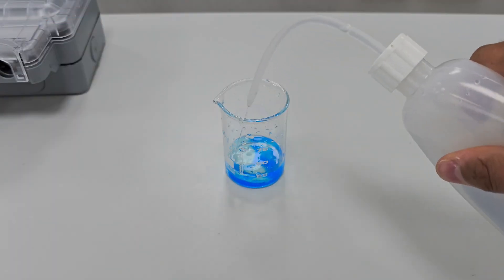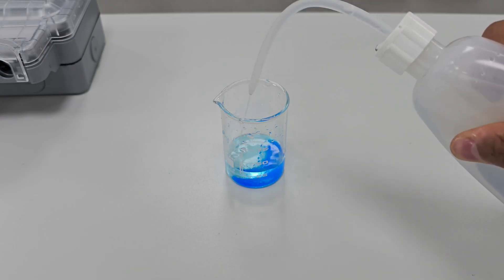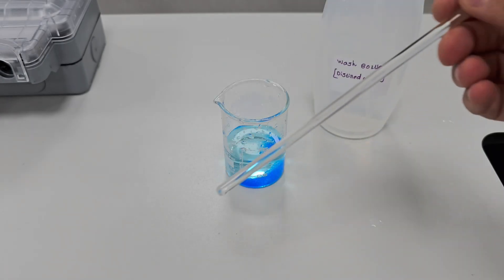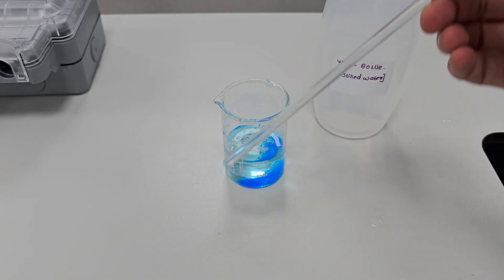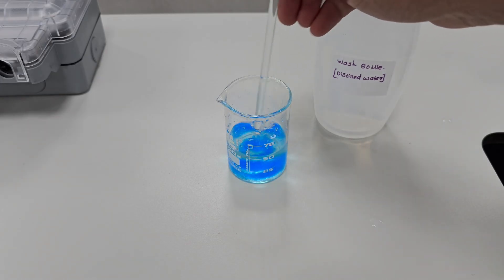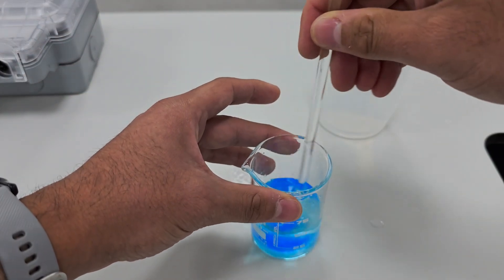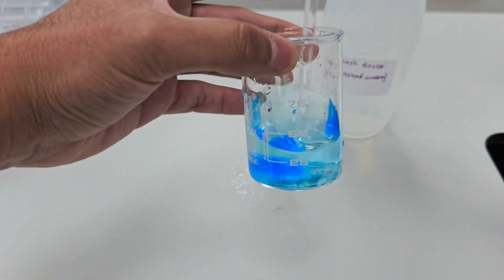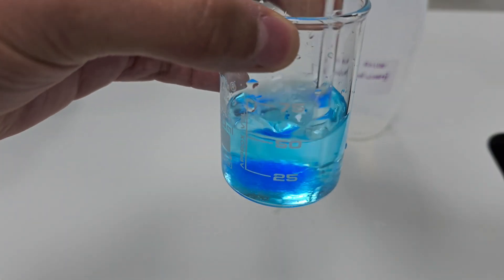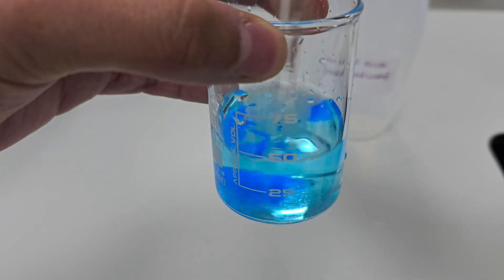Next I add more distilled water to the beaker and begin stirring the mixture. It's important to stir until all of the copper sulfate crystals are completely dissolved. You want the solution to be homogeneous, so keep stirring until you can't see any solid at the bottom of the beaker.